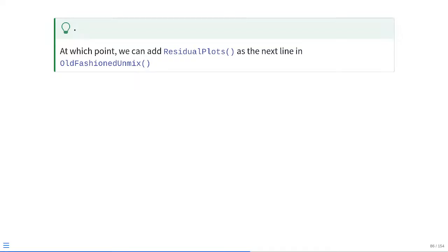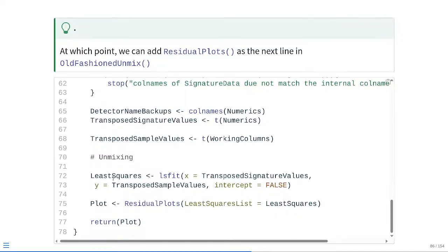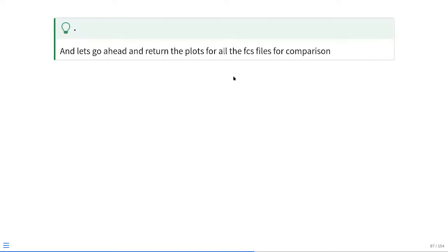So we can just go ahead and add that into old-fashioned unmix as the next line after we do the unmixing. So from our least squares named object that we get back here, just passing it indirectly, we're getting back our little plot, and then we're setting the plot to be returned to our local environment. And then at that point, we can just go ahead and plot residuals for all these FCS files so that we're able to see the comparison.